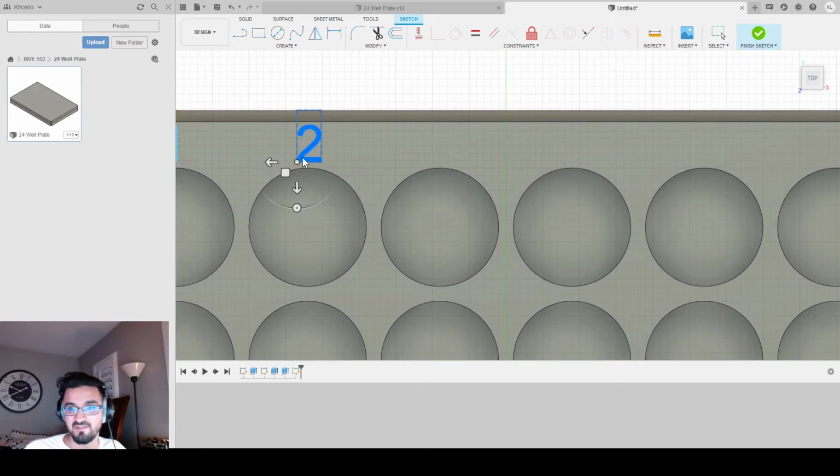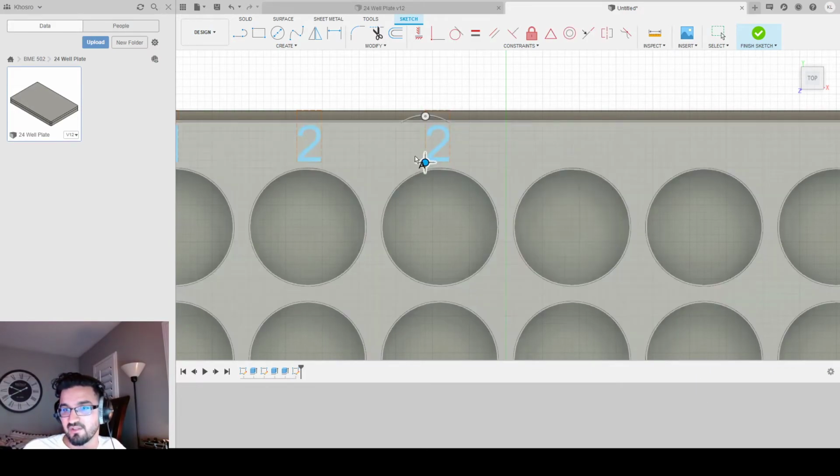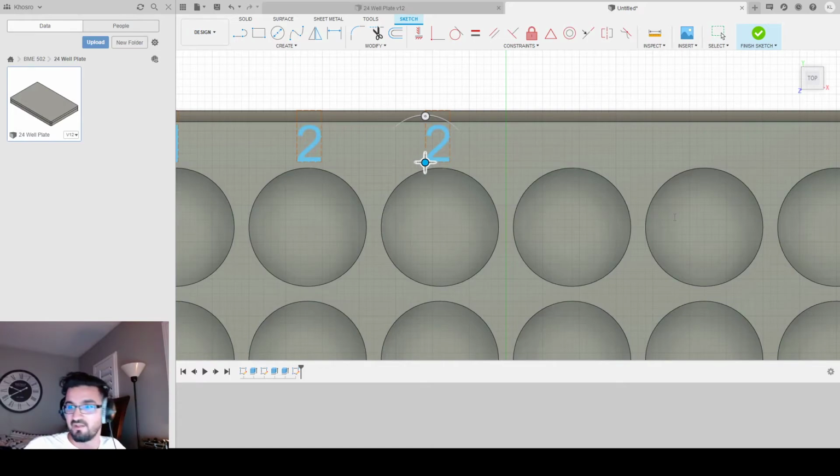Select it, copy, paste. Just copy pasta all over again. That's about center. I'm going to do 17.5. Okay. Double click. Change that to a 3. And keep going. Just copy pasta. Make sure you're only choosing one direction, right? So everything's at least level, you know? And we're going to keep going. Change this to a 4. Same height, same everything, same angle.